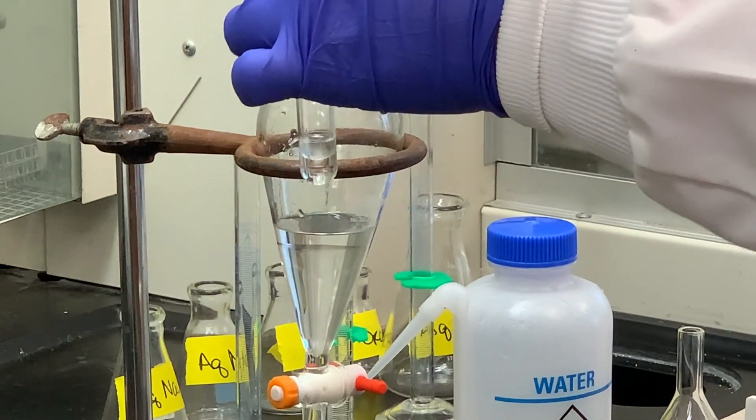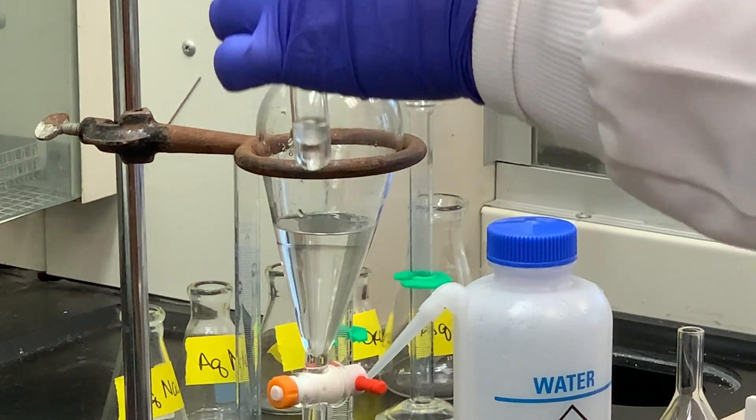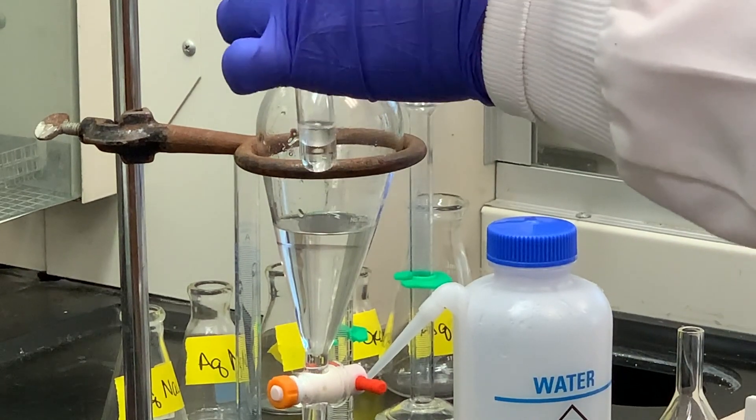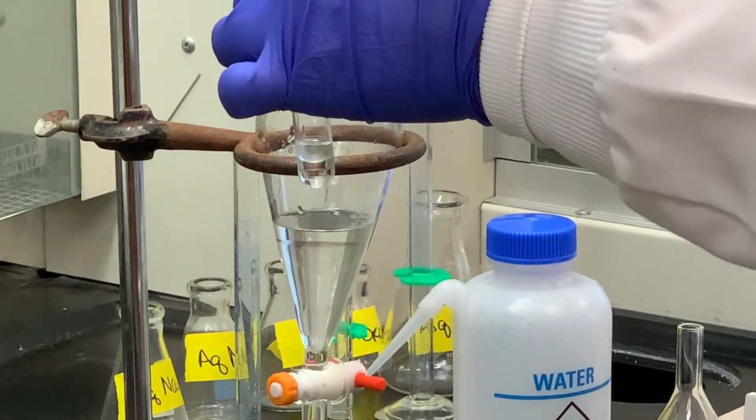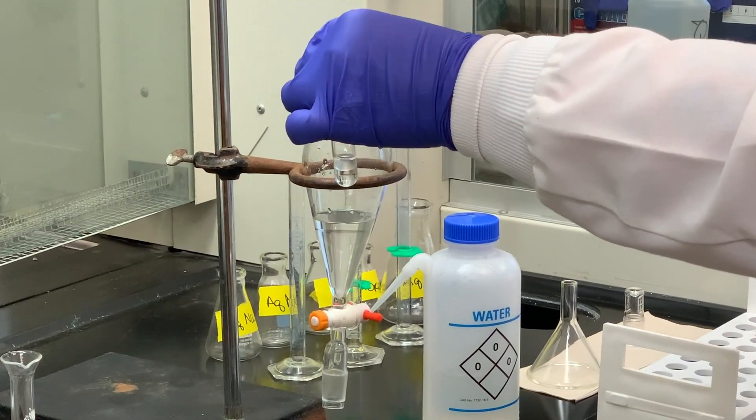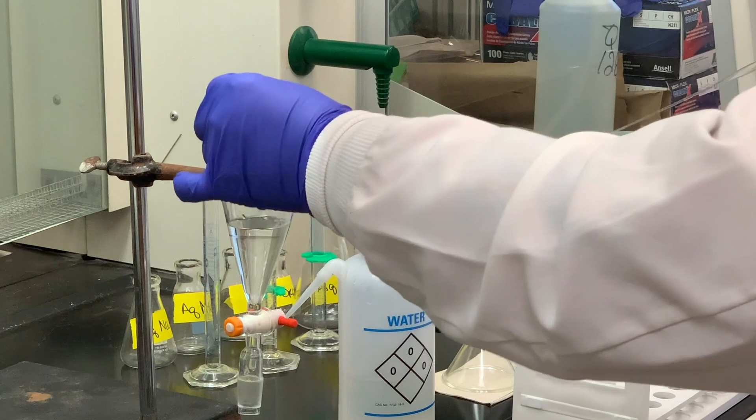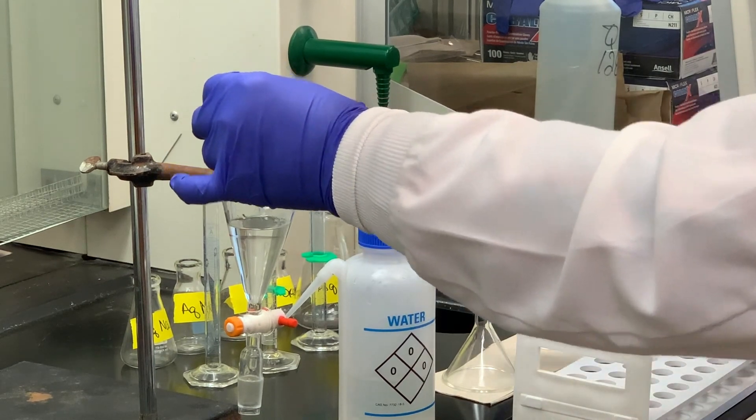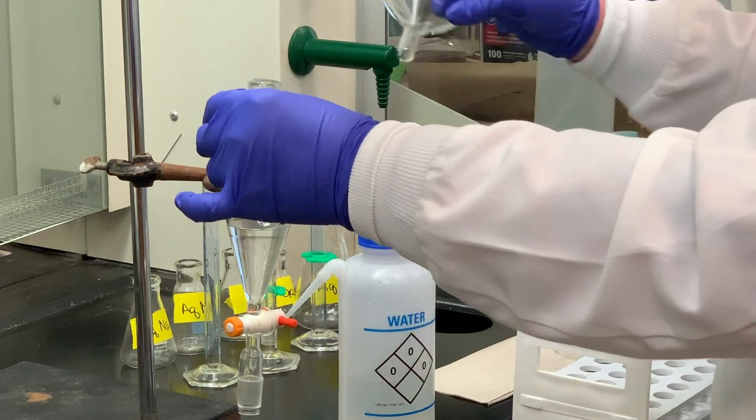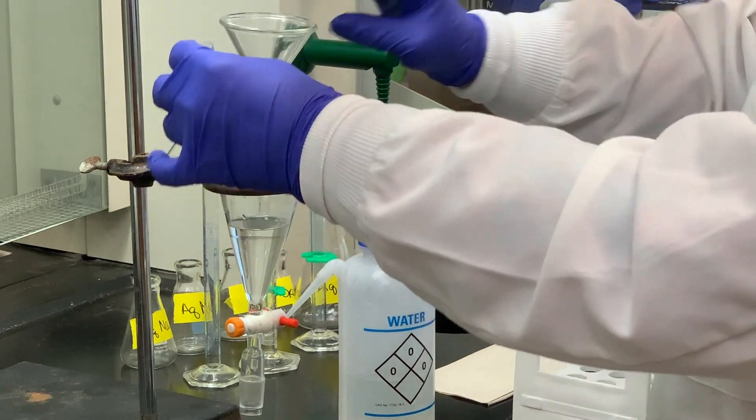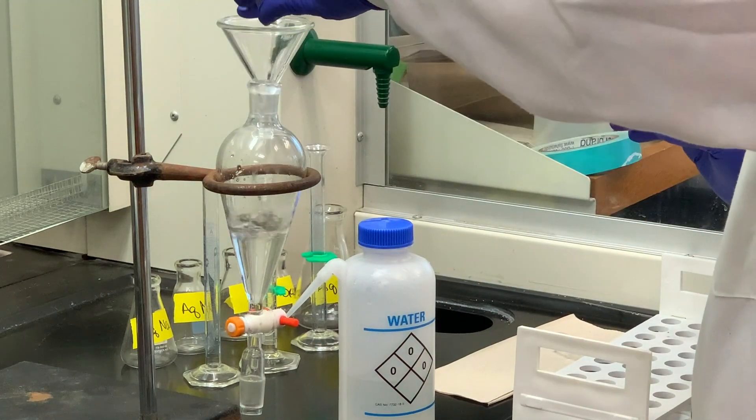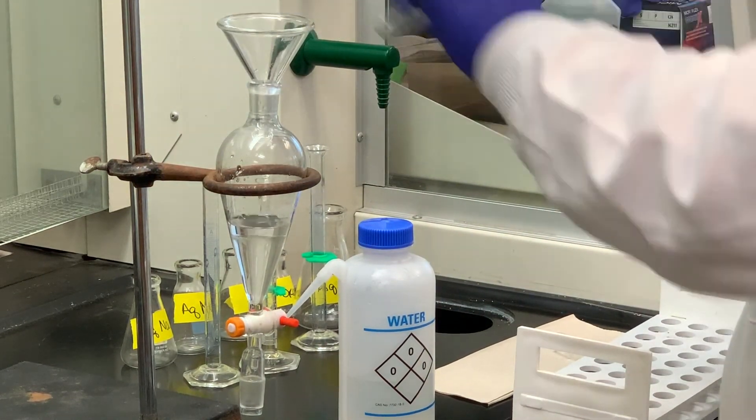Now, you could test that each time you do an extraction, but since everything we're going to be extracting it with is aqueous-based, there's really no reason to do that, but if there's ever any doubt, you can always do this test tube test. And the nice thing about the test tube test is that I never lose my material because I can pour it right back in there, and the layers will separate like they should.